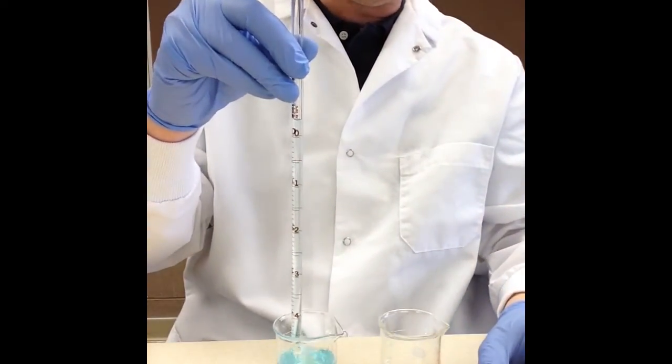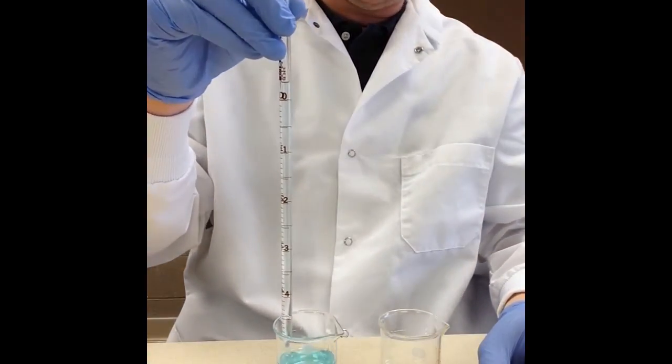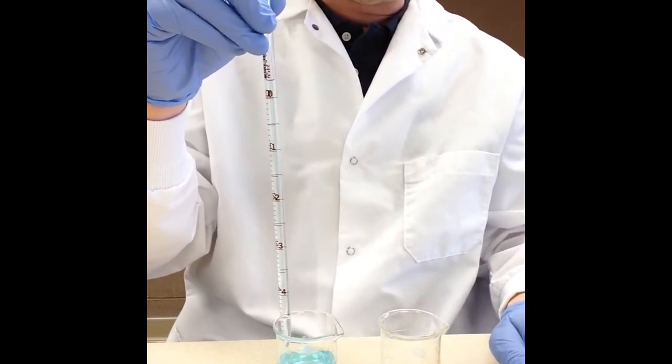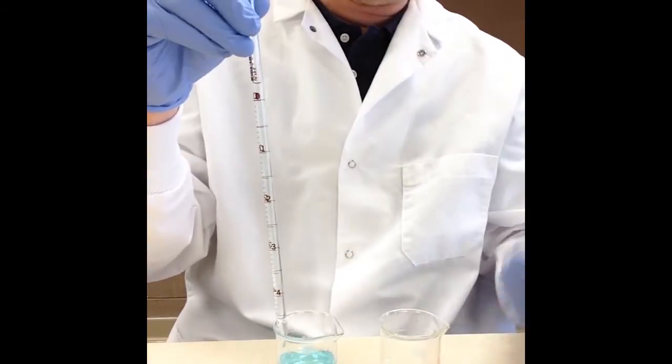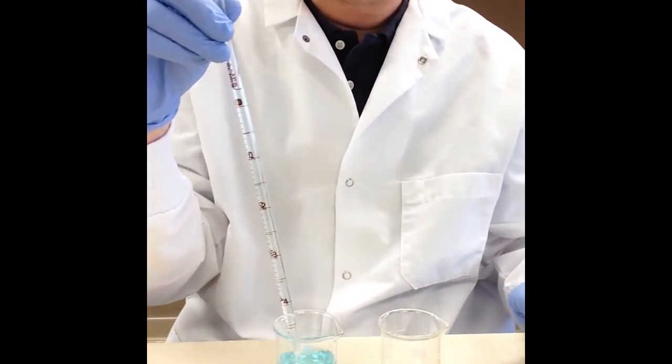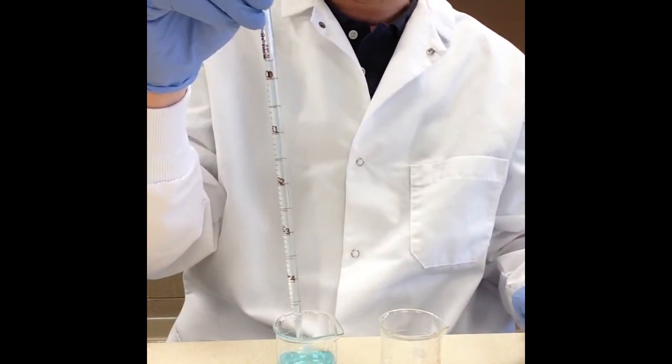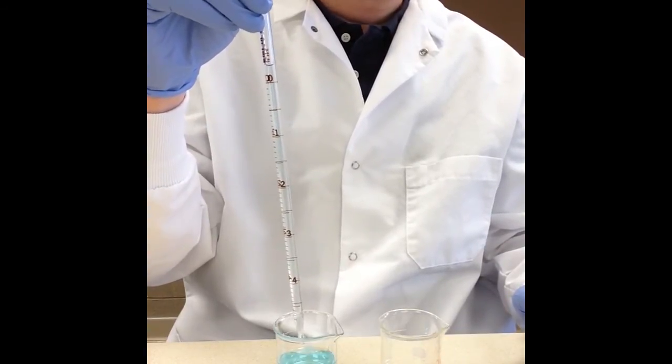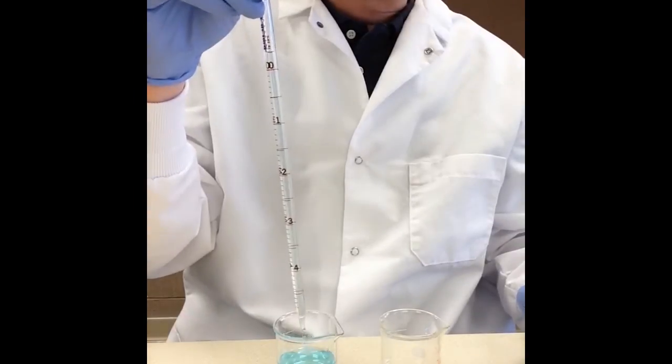What I need to do is I need to quickly take this off and get my finger on the top. Now in my procedure it says use your index finger but I also see students using their thumbs, and well not just students other lab techs using their thumbs. So really whatever you're comfortable with, whatever works for you and allows you to perform this procedure, that's fine.